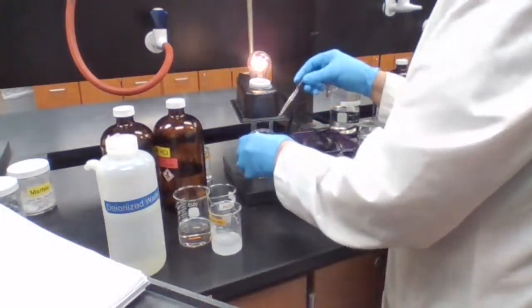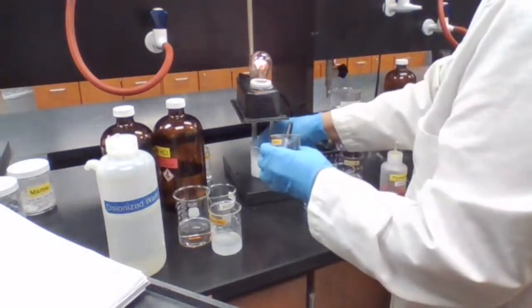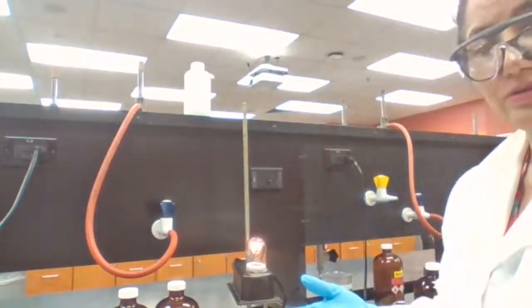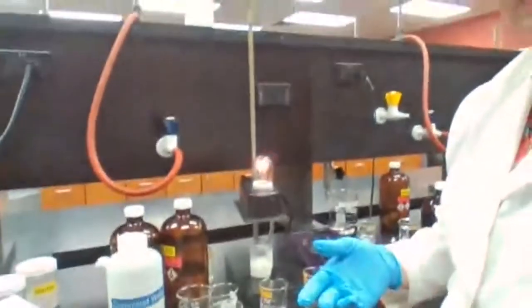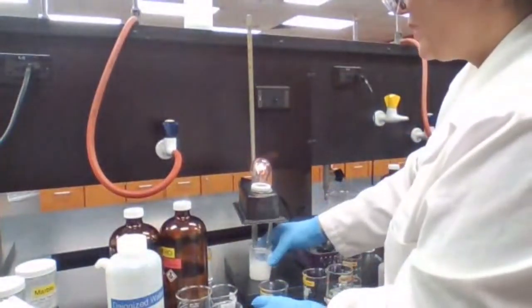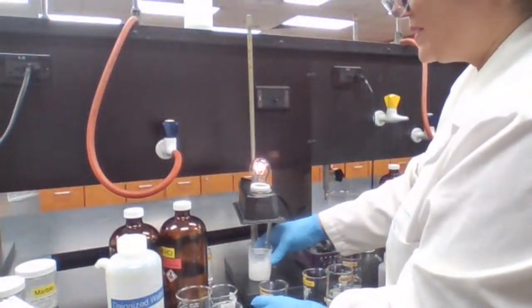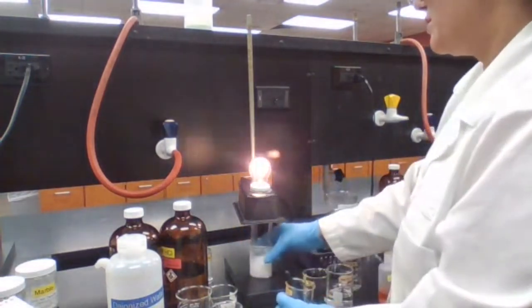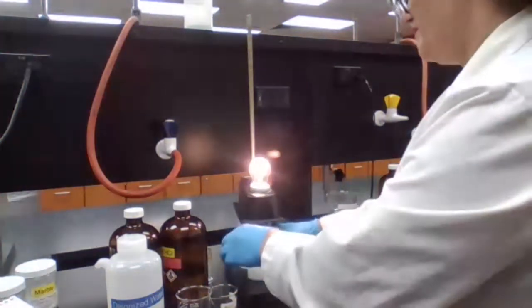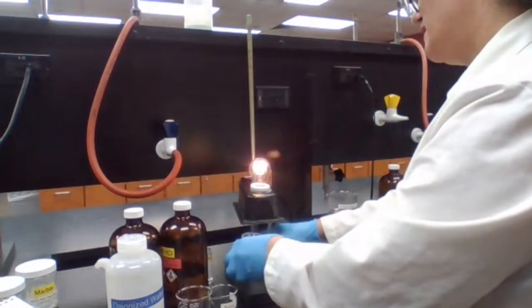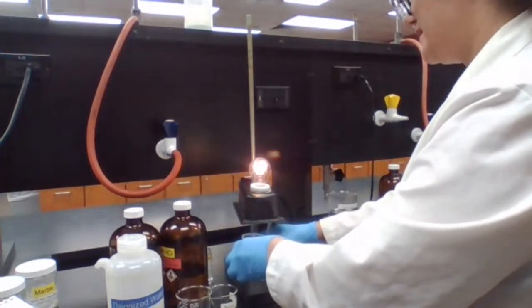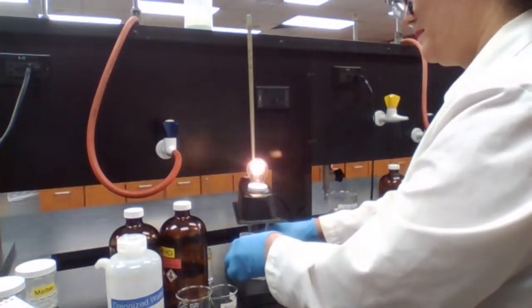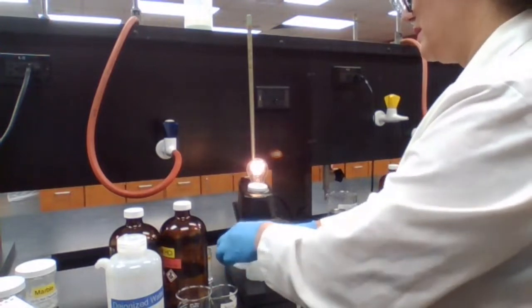To neutralize all the base, it's going to actually turn off. Your reactants are strong electrolytes, but the product is going to be very weak electrolyte. In a way, it's not actually an electrolyte. It's going to turn off the light if I add enough of the two that I get to the point of neutralization. So basically there is no leftover of the acid or the base.